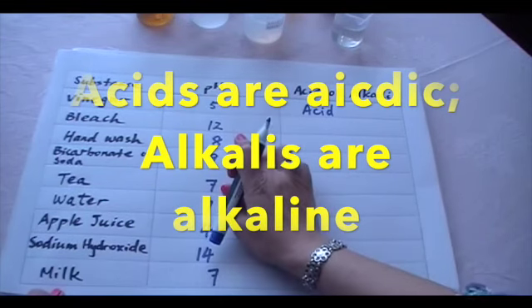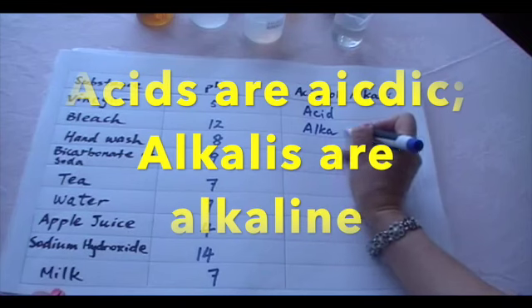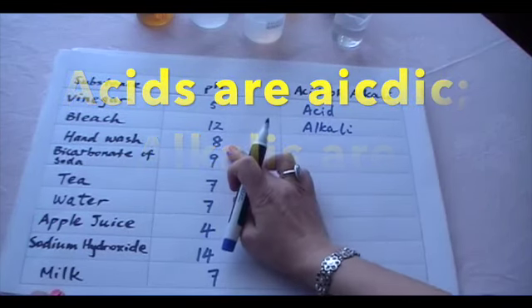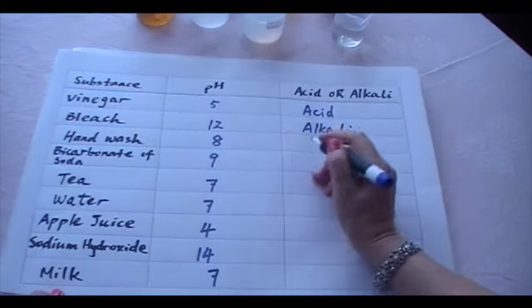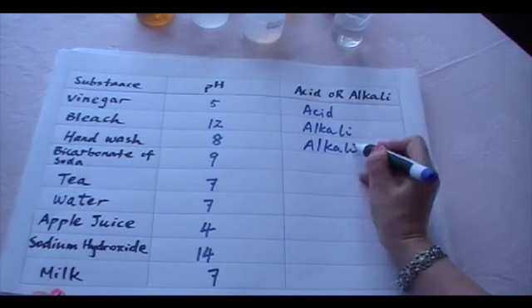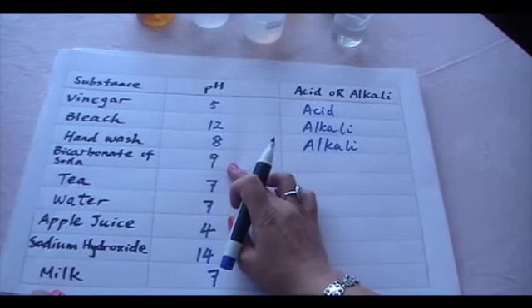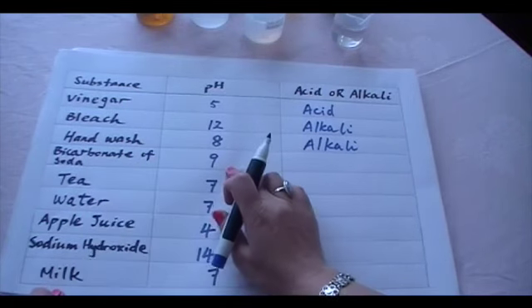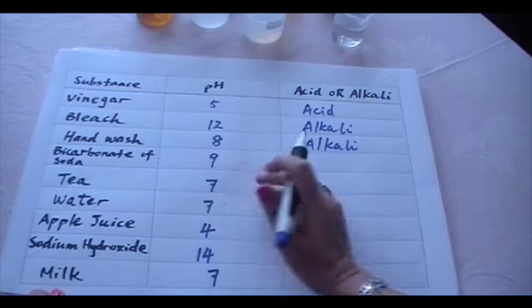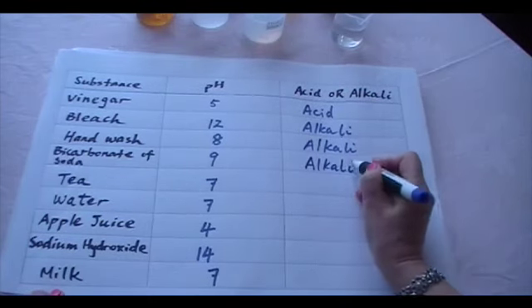And bleach, greater than 7, is an alkaline. And hand wash is also greater than 7. It is alkaline, but it is a weak alkaline because it's very close to 7. And bicarbonate of soda is also alkaline because its pH is greater than 7.